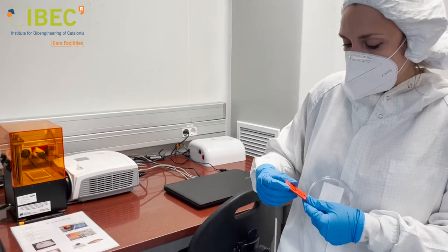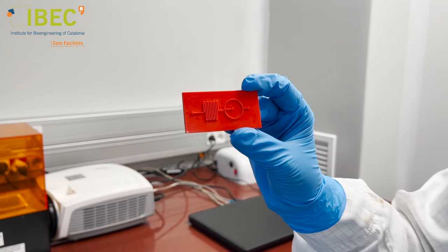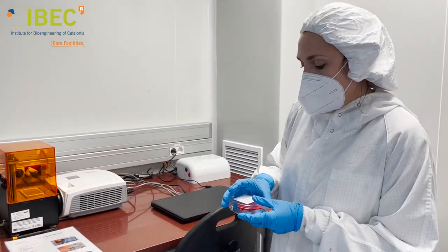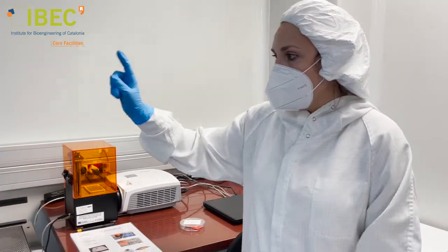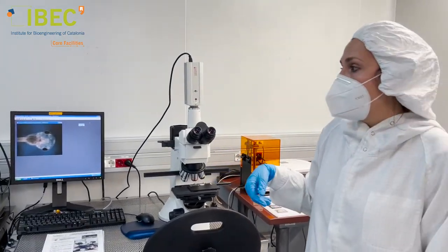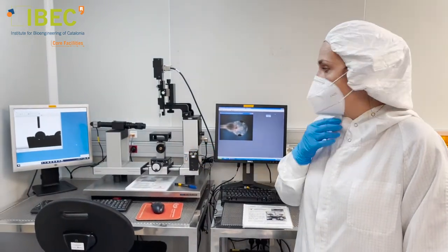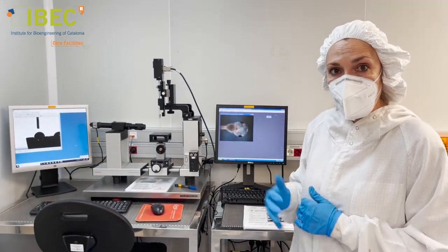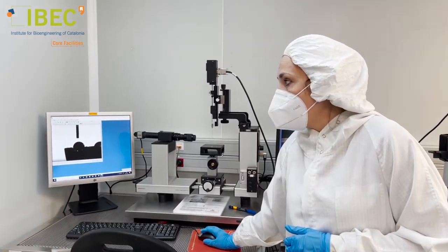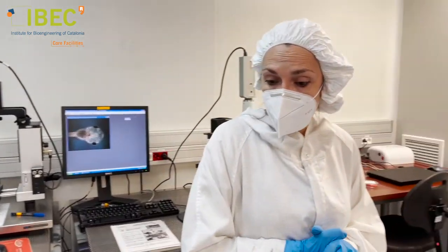This is an example of a structure fabricated by this technique. This piece can be characterized, for instance, on this machine — this is an optical microscope to characterize the size of this type of microstructures. This is a contact angle setup to measure surface interaction between different substrates. This, for example, is a measurement of hydrophobicity, which is very important in our biomedical world.